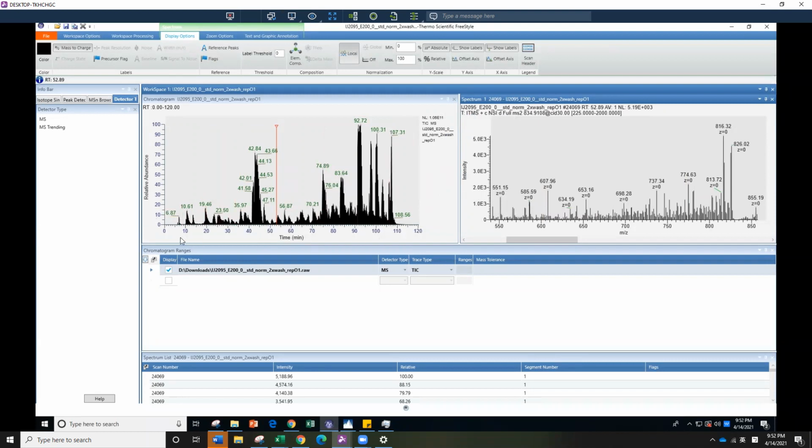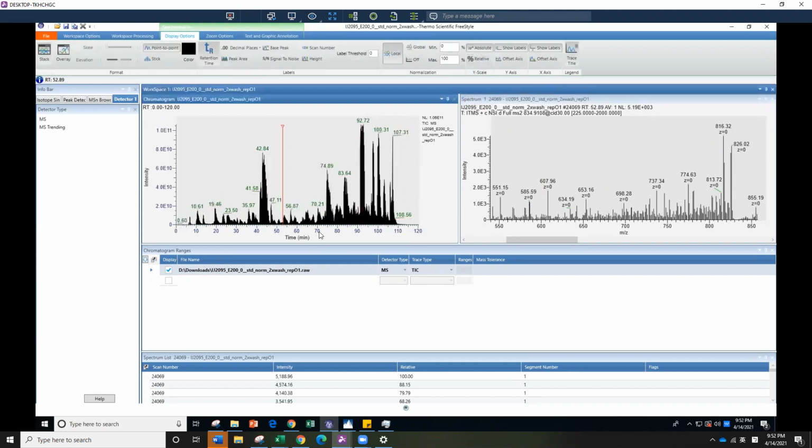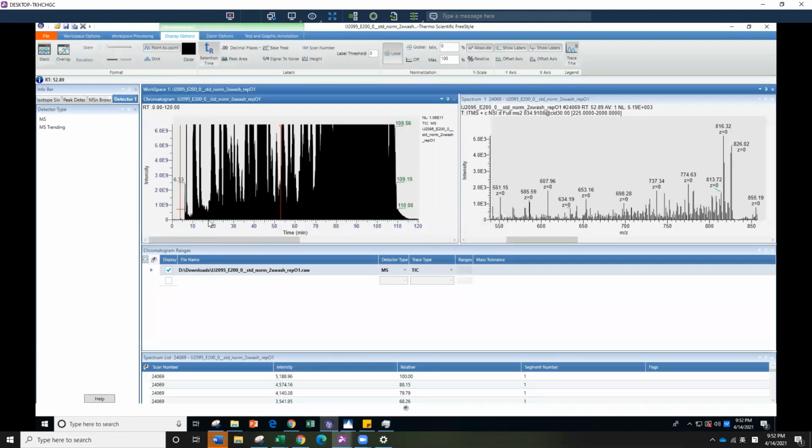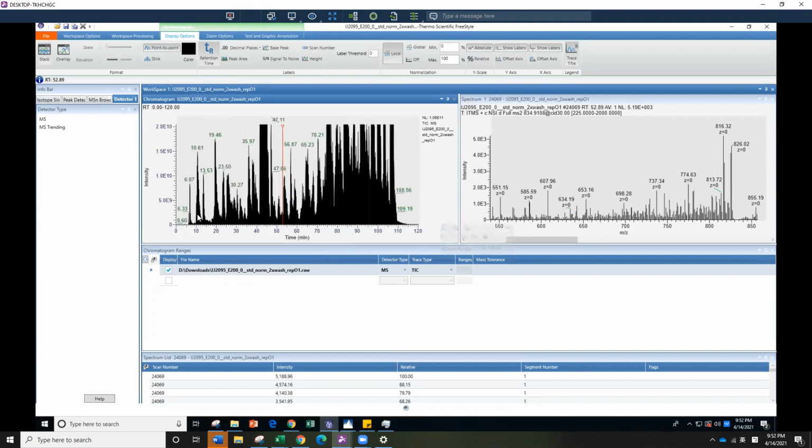The other thing you want to look at is the features of your spectrum, or chromatography, to see if it looks normal. This is a really good data set, so I don't have anything to show you that is bad. But I like to change it to absolute, because for serums we know it is dominated by serum albumin. So it is reasonable that at some retention times you might have huge signal. The less abundant, trace-amount proteins might be in the noise range, and we may not have distinguishable peaks. But you want to look at most of your data, and mine is at about 2e to the 10 range, so it's pretty good.